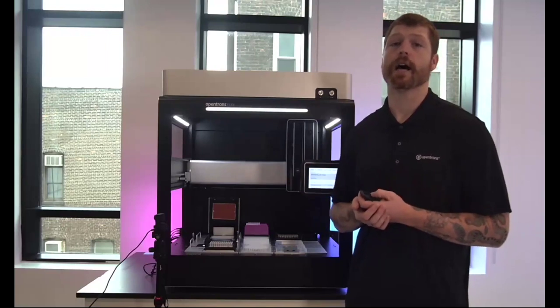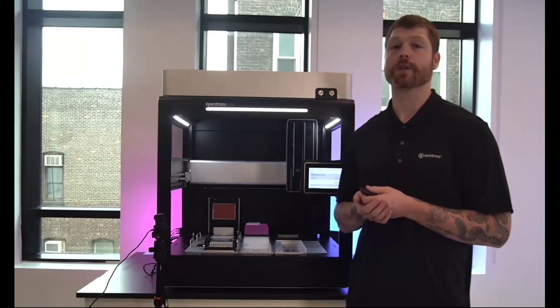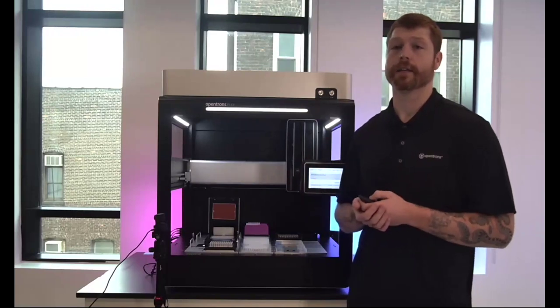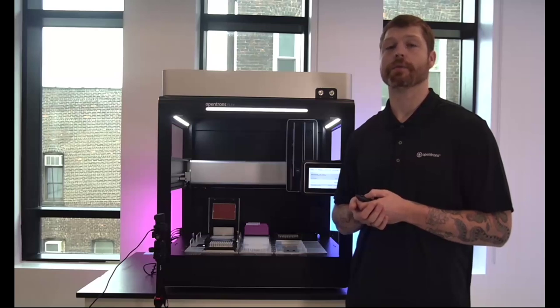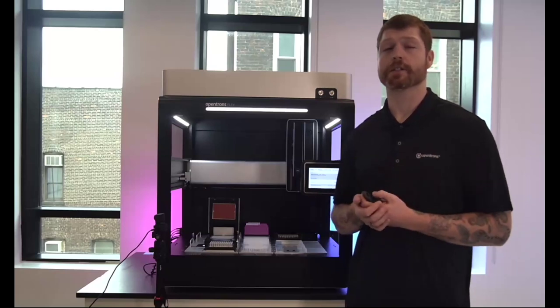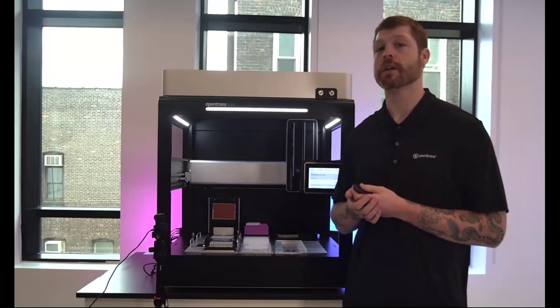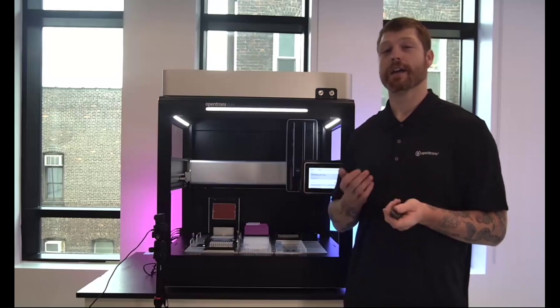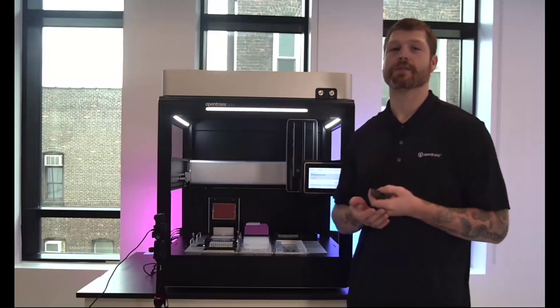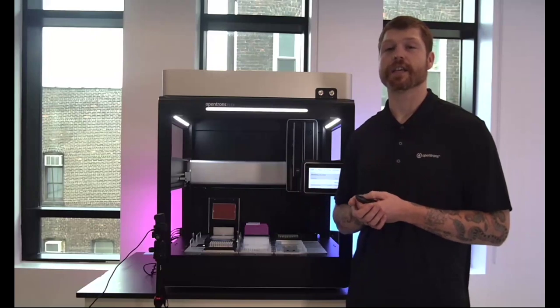And the last thing that I'll demo today is our updated runtime parameters, which have now been extended to include CSV files, which you can update both in the protocol app or on the Flex touchscreen to dynamically set up a protocol through a CSV. This is really helpful for things such as normalizations and cherry picking, but can be down to details around pipetting features and what labwares are on the deck and really specific transfer features as well. So people use CSVs for a huge number of different applications, and we just want to continually strive to make it easier for the end customers to do so.